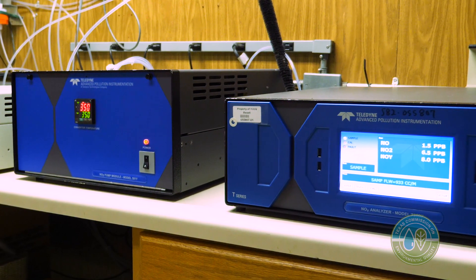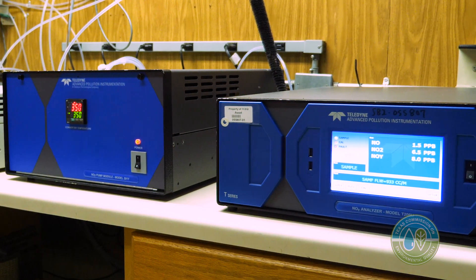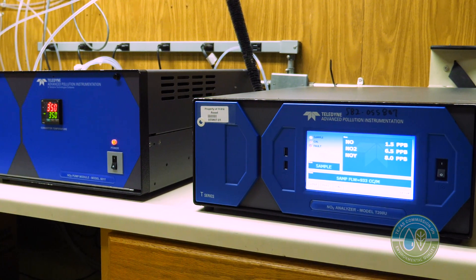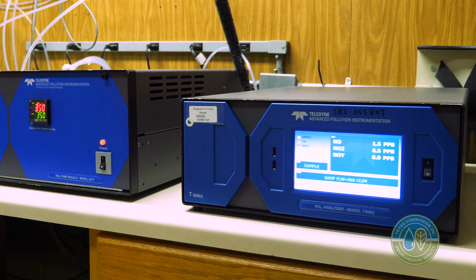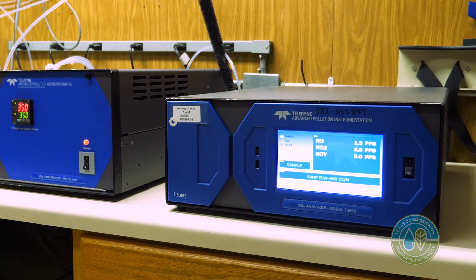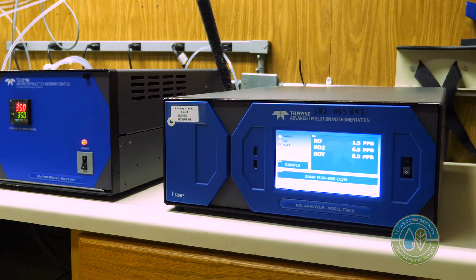Or there might be gaseous analyzers that measure ozone, nitrogen oxides, carbon monoxide, or sulfur dioxide.